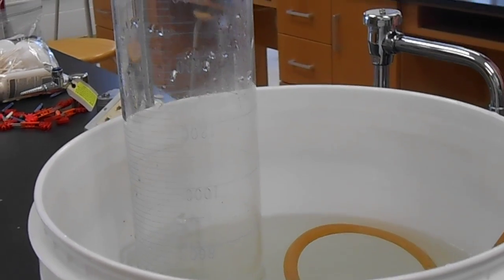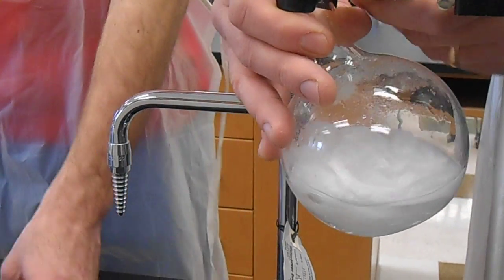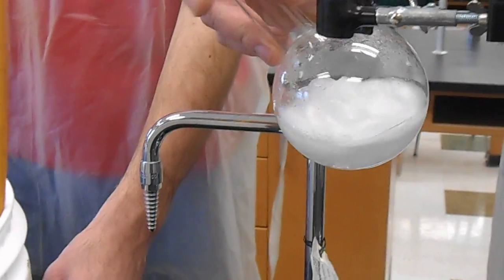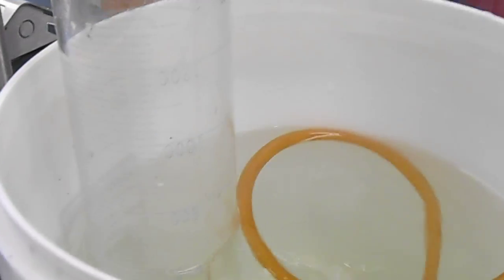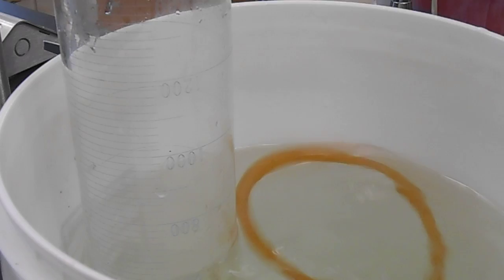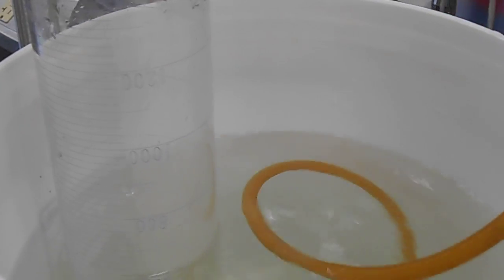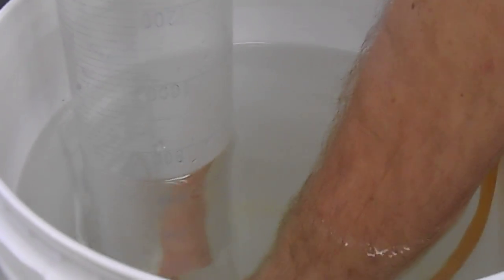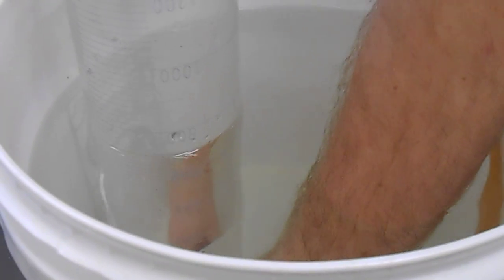At this point, we've captured about 1.5 liters of gas. It's at the bottom.